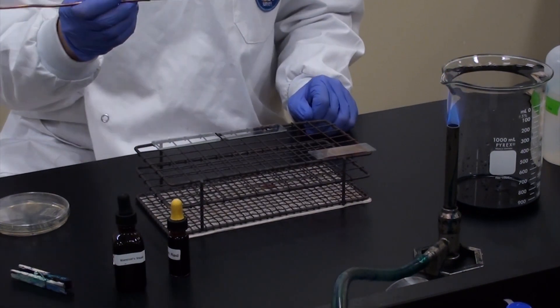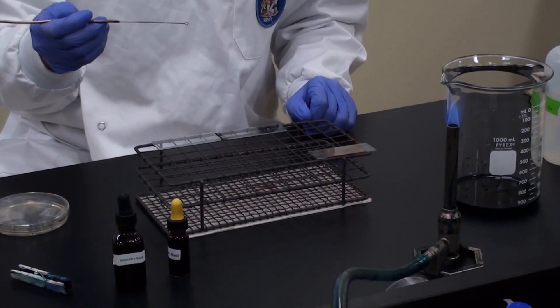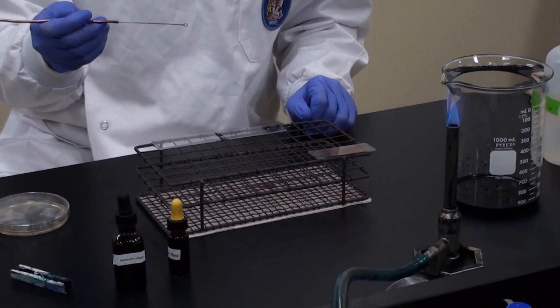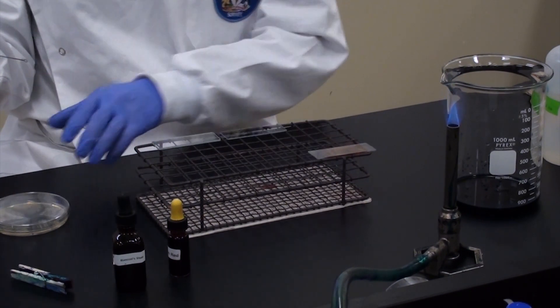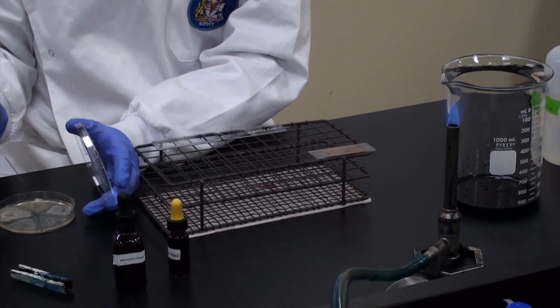At any rate, now we're waiting for it to cool. Sing a song if you feel the need. But you're all adults, so I'll let you make that decision yourself. And once you believe it's cool, you can test it by touching the gel.